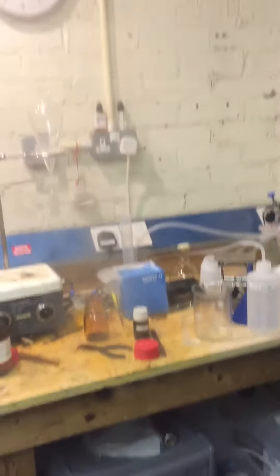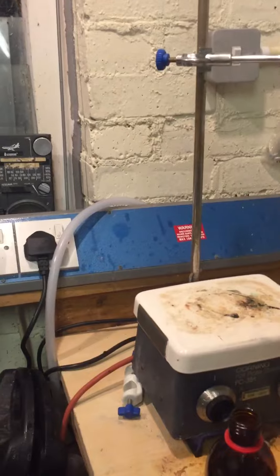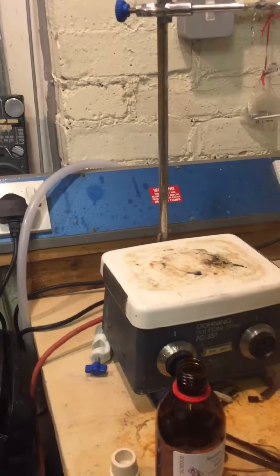Okay, bromine vapours are, to some extent, expected, of course. But I'm also getting sort of white smoke.